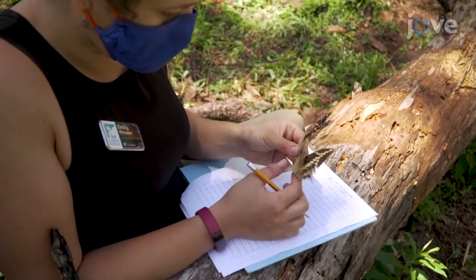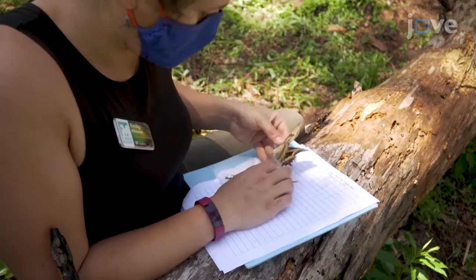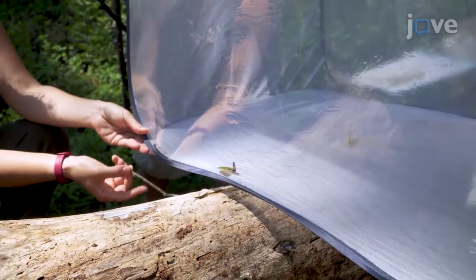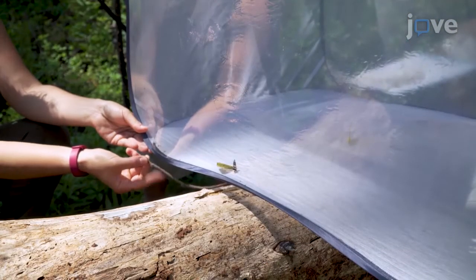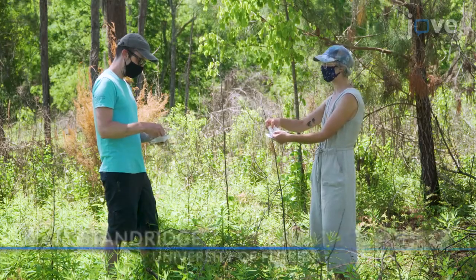Handling insects without damaging them takes practice, but practice makes perfect. Defining the parameters of your experiment, like how long to keep insects in ice water, can take time, and it requires experimentation and understanding of your focal taxa. Demonstrating the procedure with me will be Heather Rohr and Matt Standridge, two technicians from the Daniels Lab.